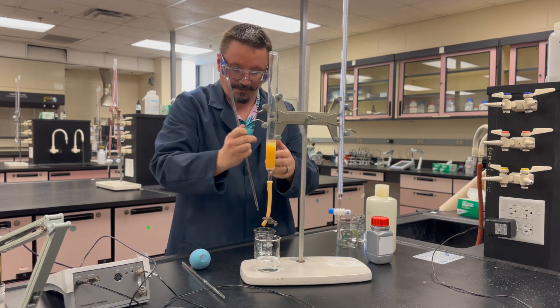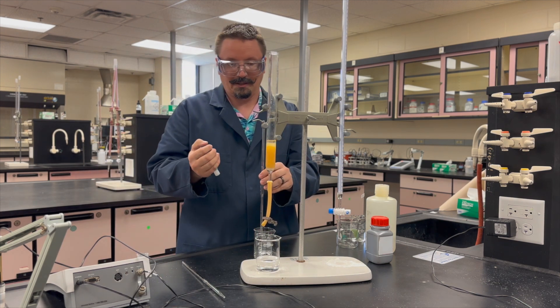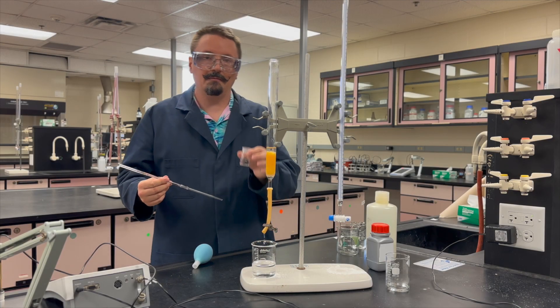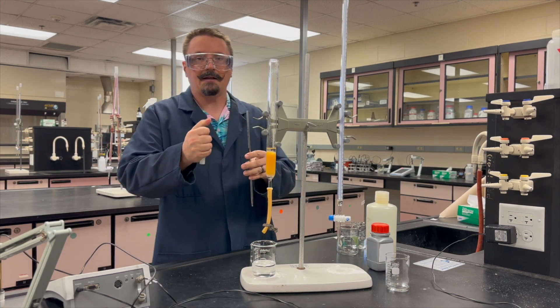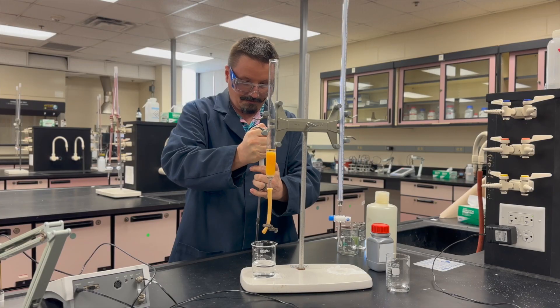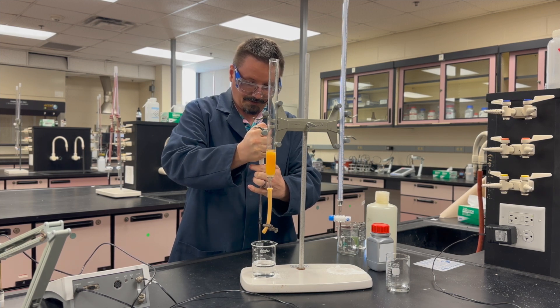Regenerate the column with the full amount of HCl — the instructions say 25 milliliters. Then we'll move to the unknown. After conditioning the column with HCl, we want to add exactly one milliliter of the unknown to the column. Once you've conditioned it and have just a single millimeter or so of liquid on top of the column, go ahead and add your unknown.